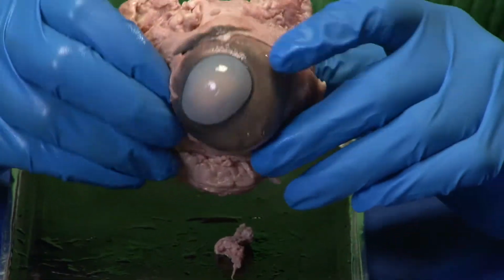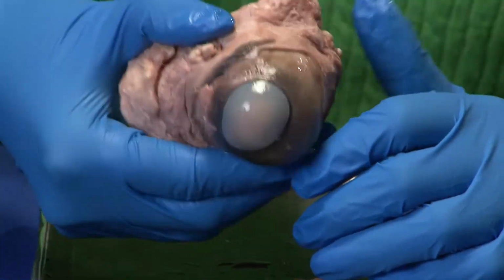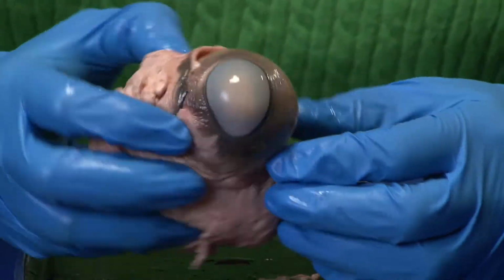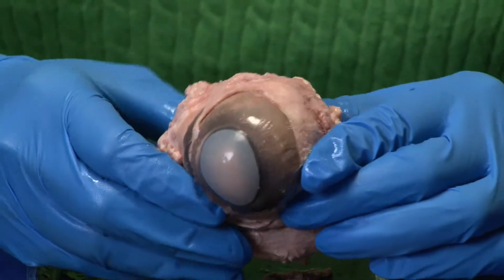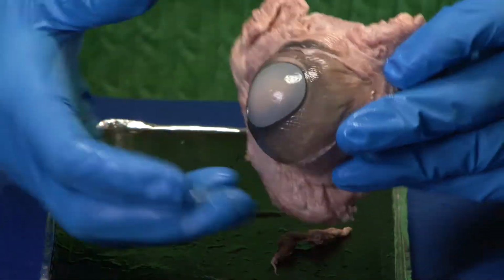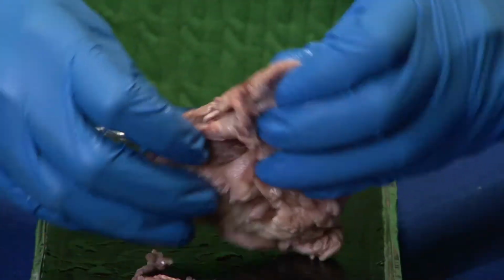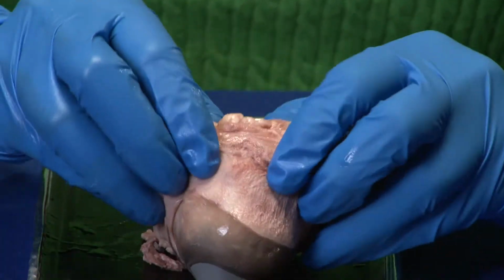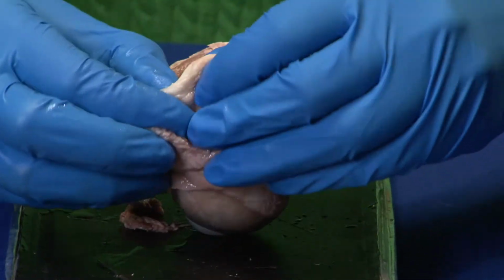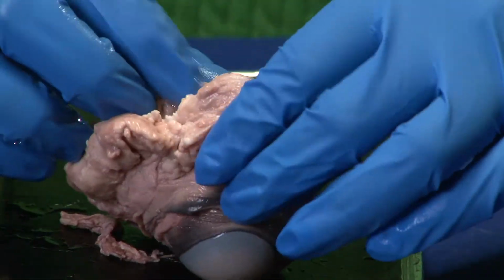Today we are going to dissect a mammalian eye, and this is actually a cow's eye. As you can see, the cow's eye looks fairly big. It's a little bit bigger than our eyes. The cow eye has a lot of surrounding tissue around the eye. Can you guess what this surrounding tissue is? You see some tissue that's yellow and white in nature, and some tissue that's pink in nature.